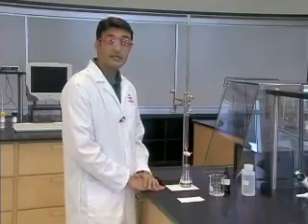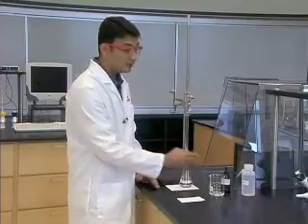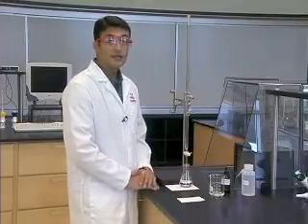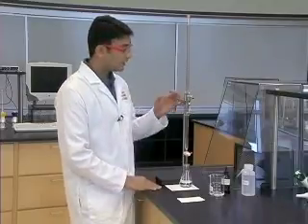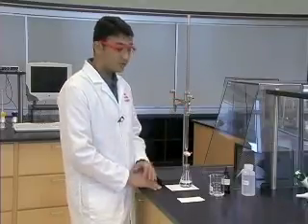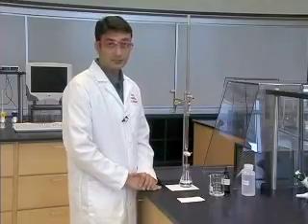Our analyte already contains the indicator. For an acid-base titration we use phenolphthalein indicator. The indicator is colorless in an acid solution. When enough titrant from the burette has been added to the analyte, the contents of the flask will turn pink. We are now ready to begin our titration.